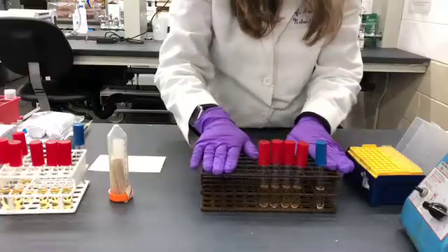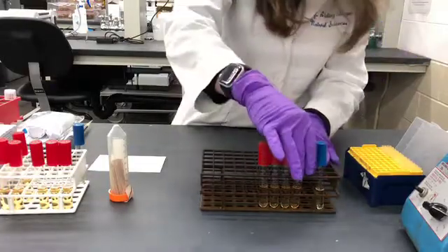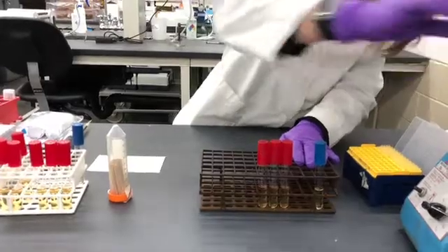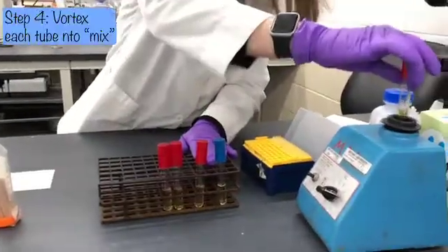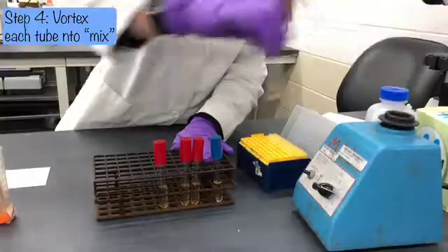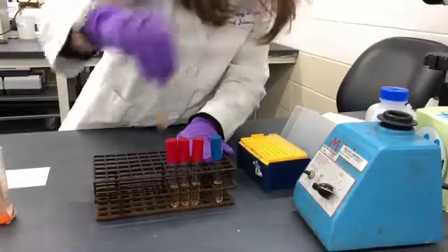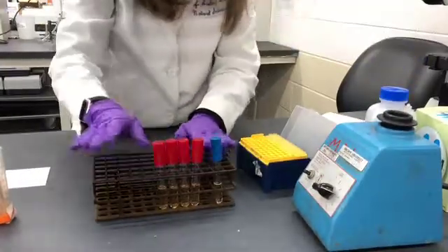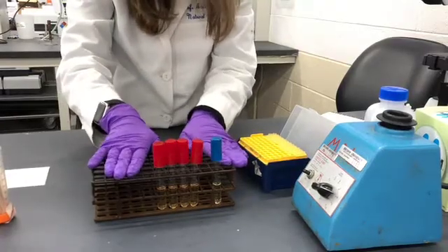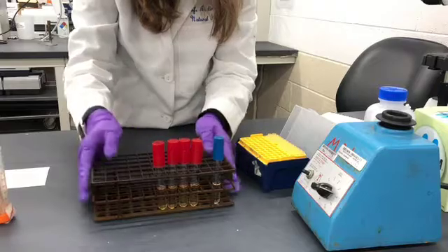In order to allow the cells to get into suspension, we'll do a quick vortex of each of the inoculated tubes. Then we're going to head over to the spectrophotometer to get a baseline reading of the absorbance of all of these specimens.